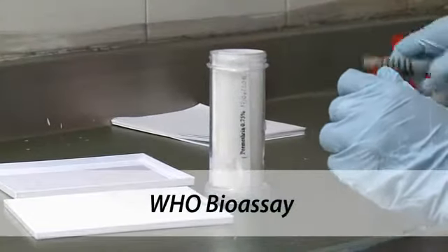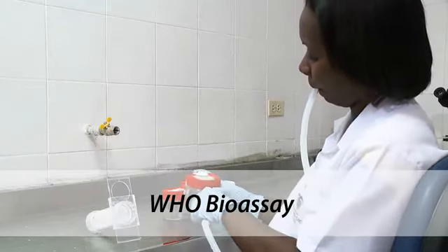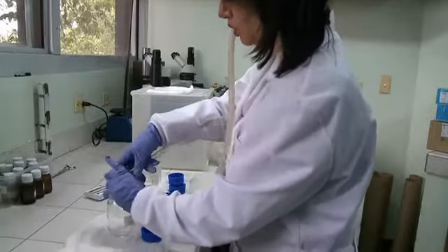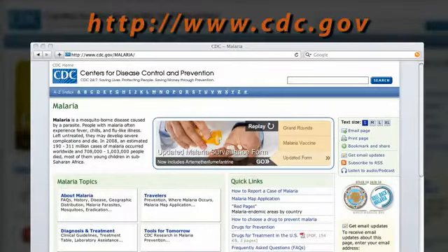There are two methods for conducting susceptibility tests: the WHO method, which uses tubes and insecticide-impregnated papers, and the CDC method, which uses glass bottles and insecticide. To learn more about the CDC method, visit their website.